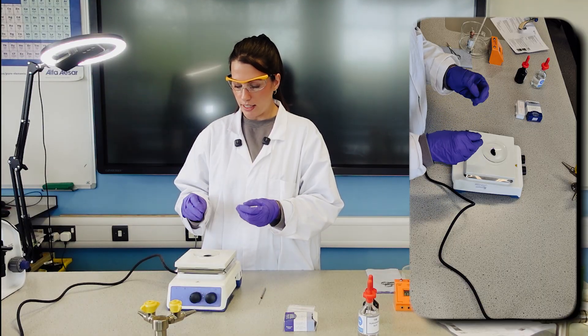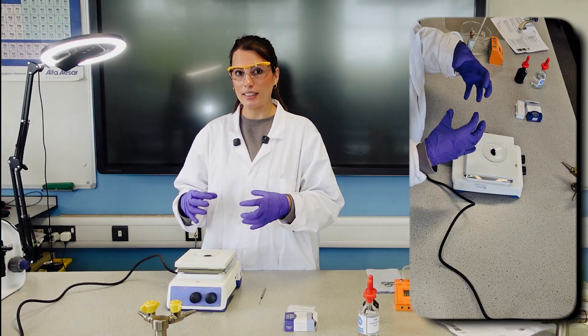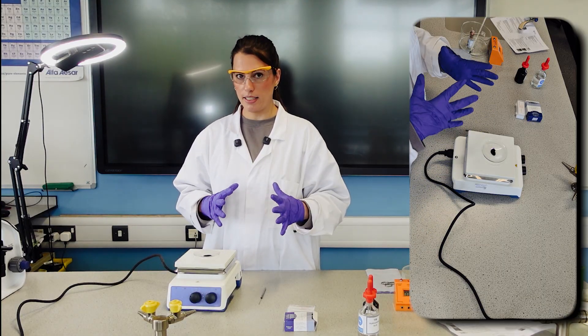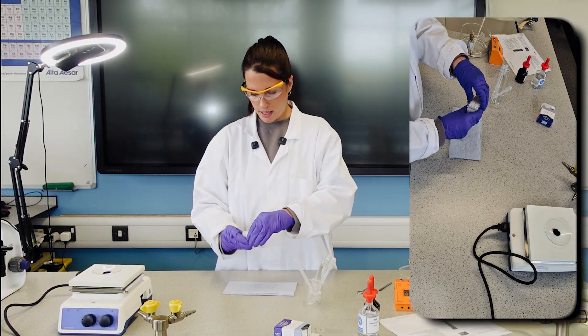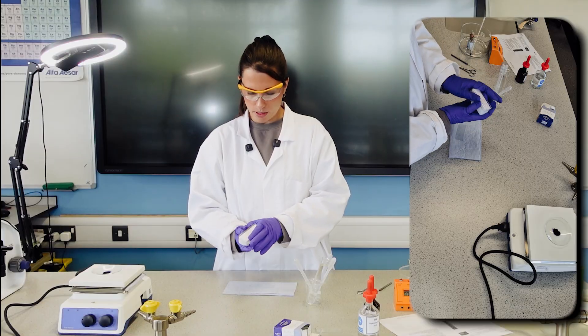This is to give a chance for that stain to get into the cells, get to the chromosomes and stain them. So while I'm waiting, I've got my slide and I'll get my cover slip as well.